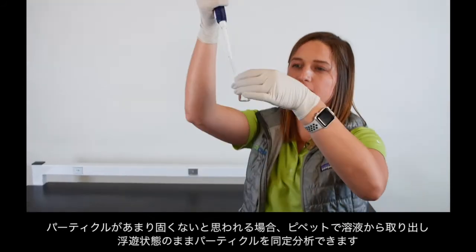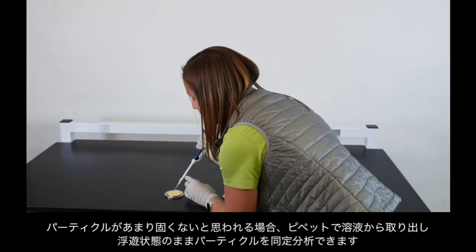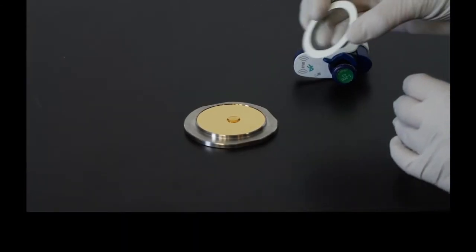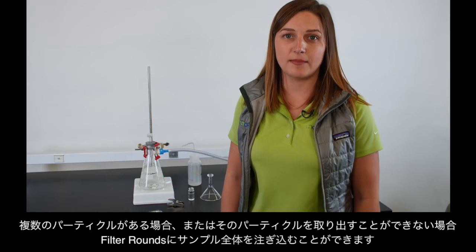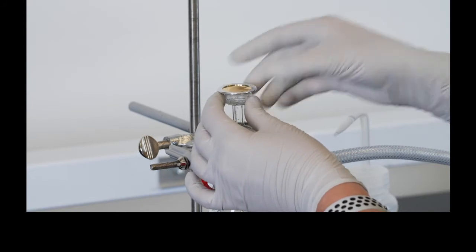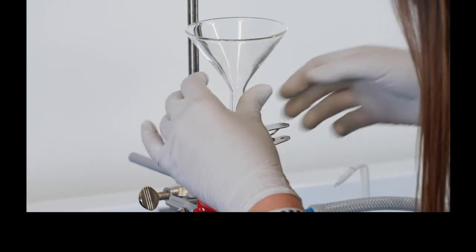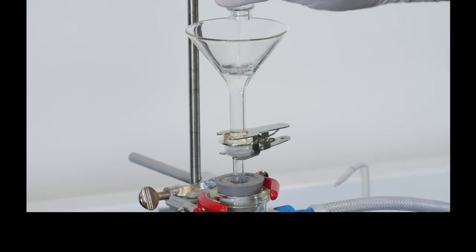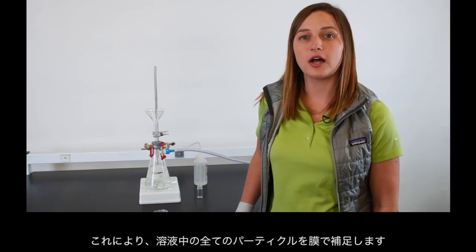If the particle doesn't appear to be very solid, I can pipette it out of solution to keep it in suspension during identification. If I have several particles or I just can't grab them, I can pour the entire sample through this filter round. That way, all of the particles are captured on the membrane.